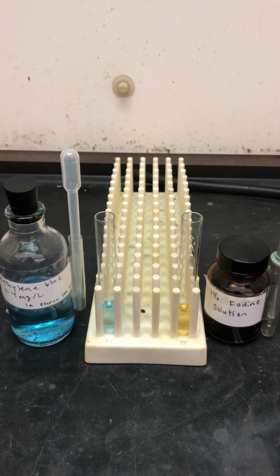In part A, we showed the different solubility properties of a set of alcohols in water versus hexane, in other words, in a polar versus a non-polar solvent. However, the observations were not very dramatic and might have been sometimes a little difficult to tell apart. So, in this example here, we're going to show with colors something a little more dramatic and also show a possible way of separating components, which is through the process called extraction.